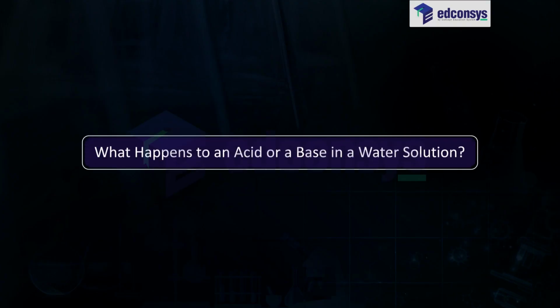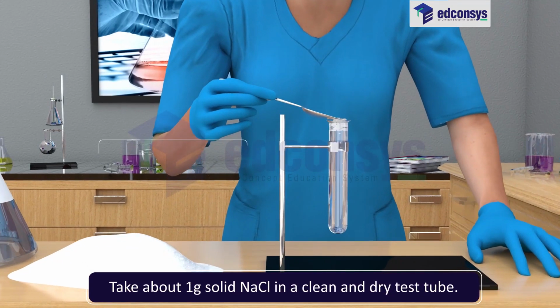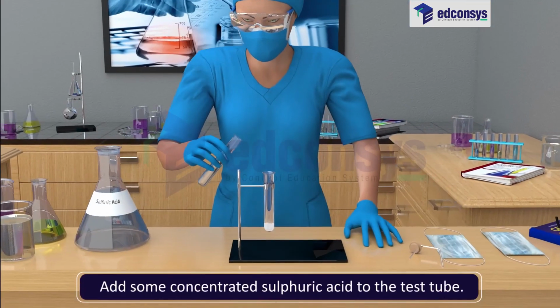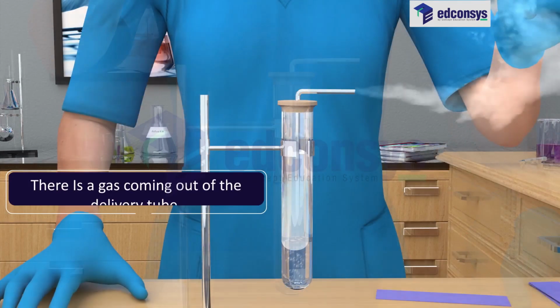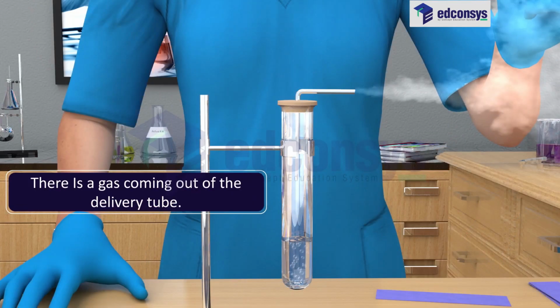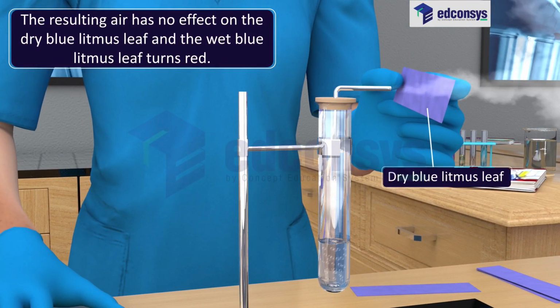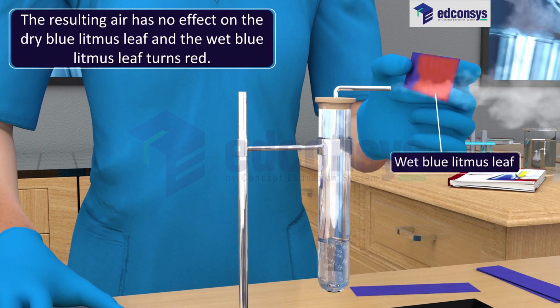What happens to an acid or a base in a water solution? Activity. Take about 1 gram solid NaCl in a clean and dry test tube. Add some concentrated sulfuric acid to the test tube. There is a gas coming out of the delivery tube. The resulting gas has no effect on the dry blue litmus leaf, and the wet blue litmus leaf turns red.